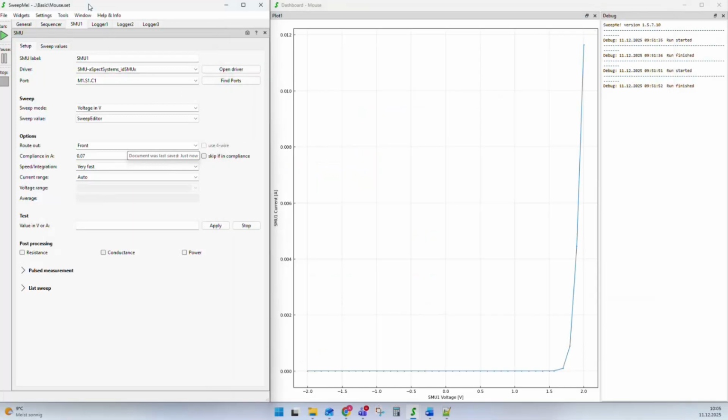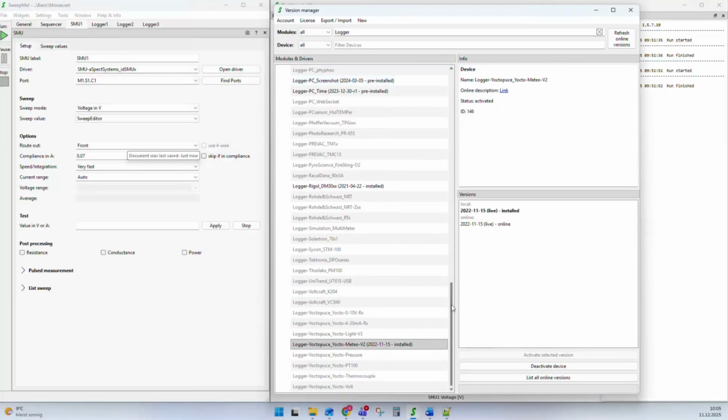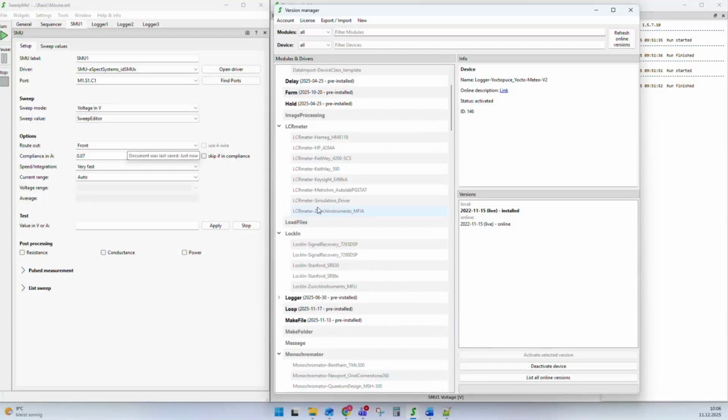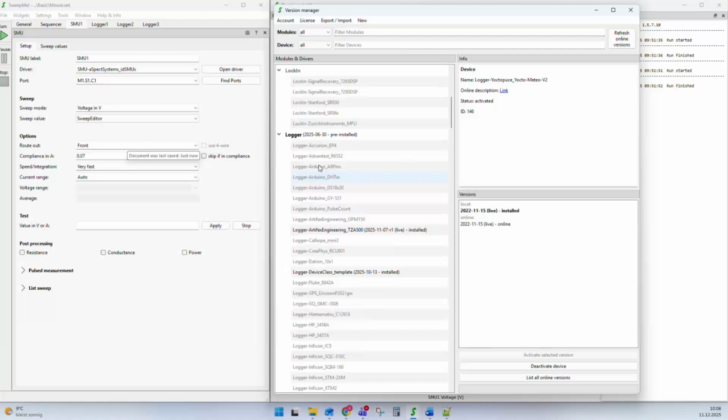To have a better look or to see all the drivers in the system, we have the menu Tools, Version Manager, and there you can see all the content in the system. We can see these bold items. These are modules, and the instrument modules, like for example LCR meter, Logger, have additional items, and these additional items are the drivers.